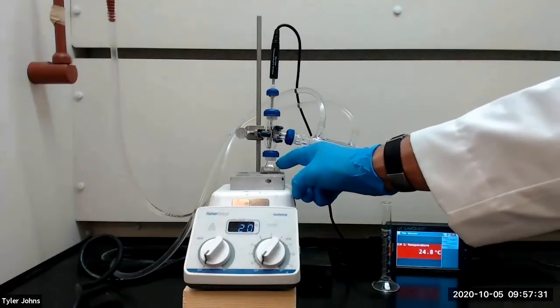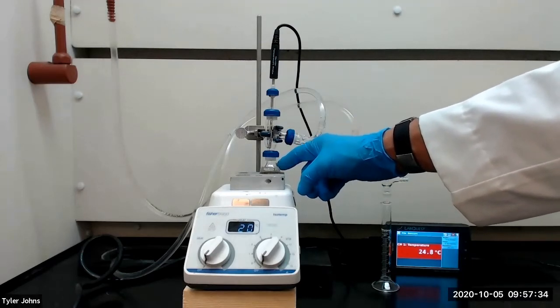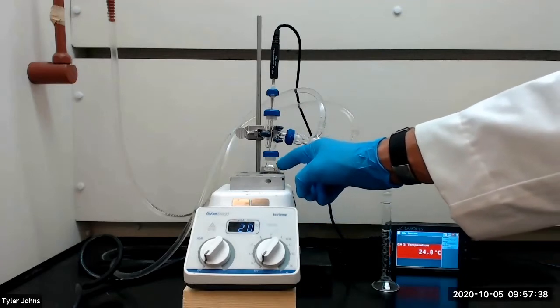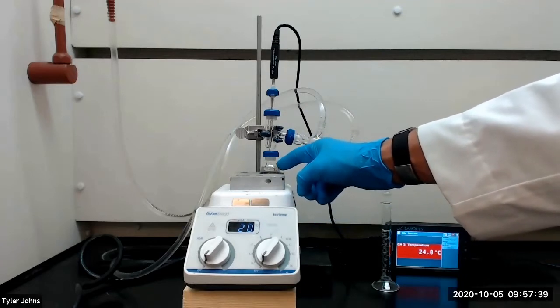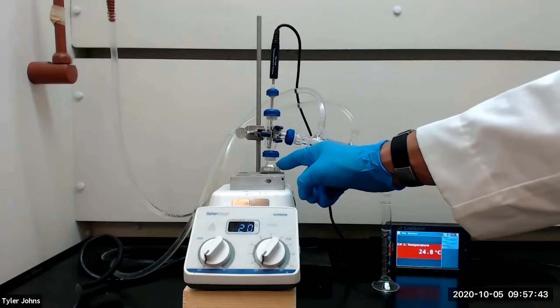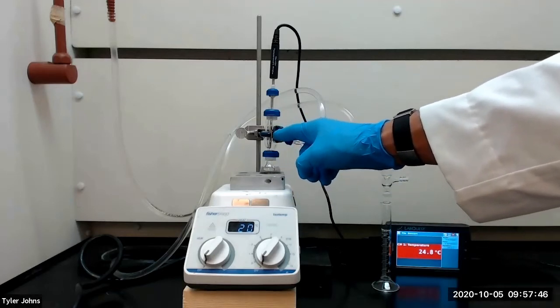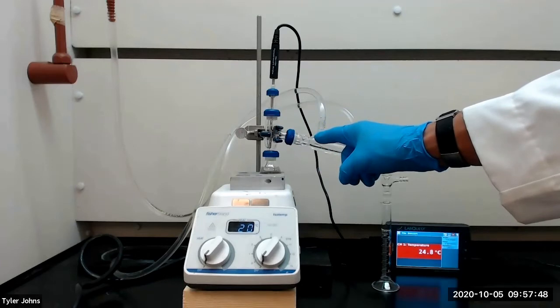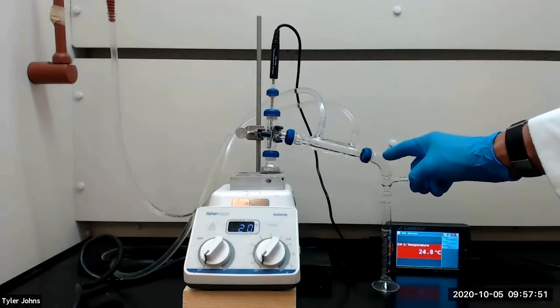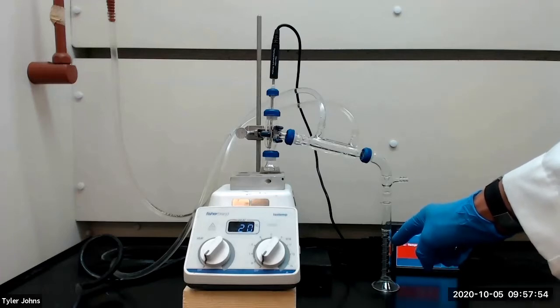We've now set our 10 milliliter round bottom flask with our eight milliliters of unknown on an aluminum block on a hot plate, and we've connected it to our simple distillation apparatus. Our round bottom flask is connected to a connecting adapter, which is in turn connected to a water-cooled condenser and a vacuum adapter, and we will condense our distillate into a 10 milliliter graduated cylinder.